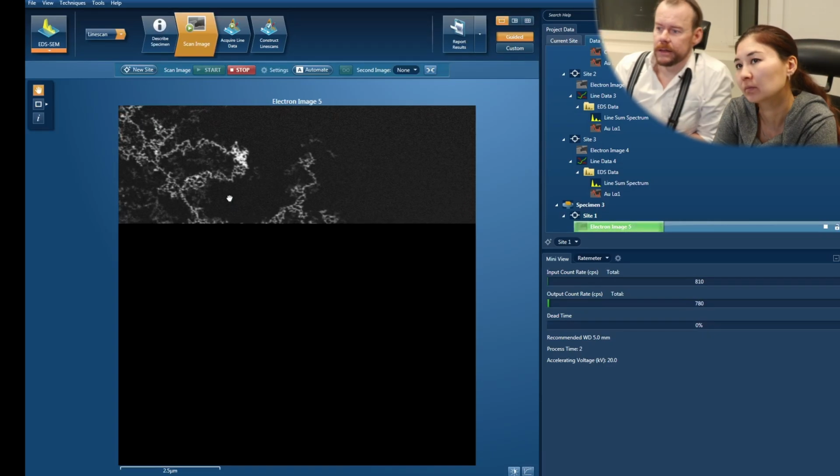So this is the view field, 10 micrometer. The view field here is almost the size of the spot. You remember the information volume we got. So we can do a scan on that just to compare with that STEM data. You remember that it was about 50 nanometer wide, the signal, when we scan across gold.